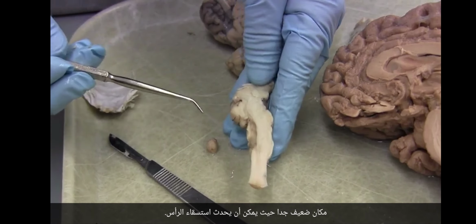And so now let's try and follow it as it goes into the temporal lobe. And we're going to pick it up right here. Okay. Look at that. There we are.